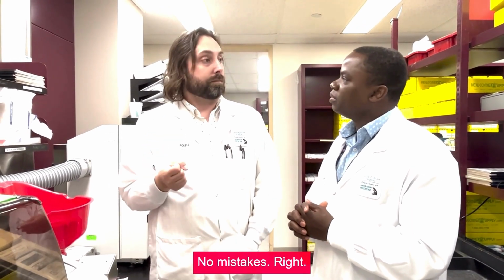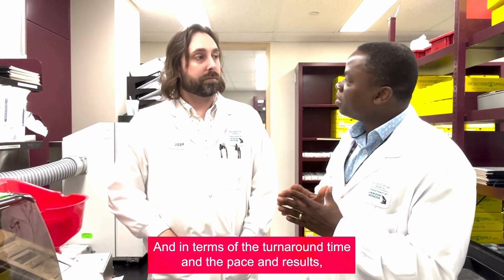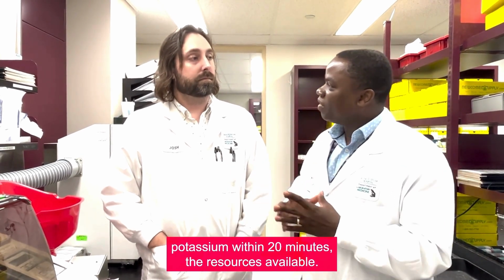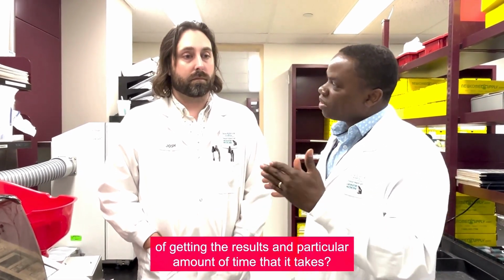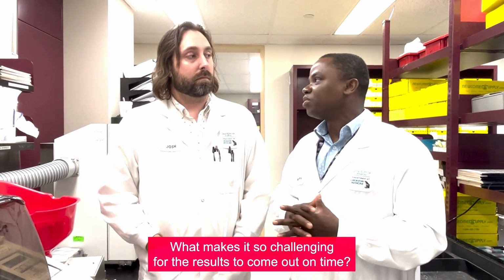No mistakes. And in terms of the turnaround time and the patient results, sometimes a chemistry result, like potassium, is available within 20 minutes. What makes histology and cytology so challenging in terms of getting the result and the amount of time that it takes? What makes it so challenging for the results to come out on time?